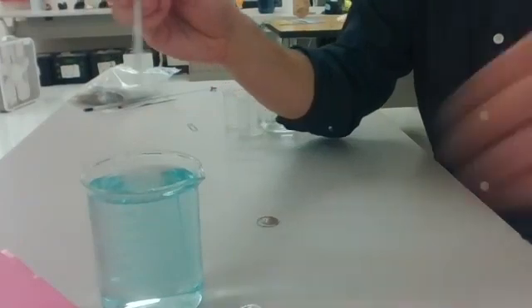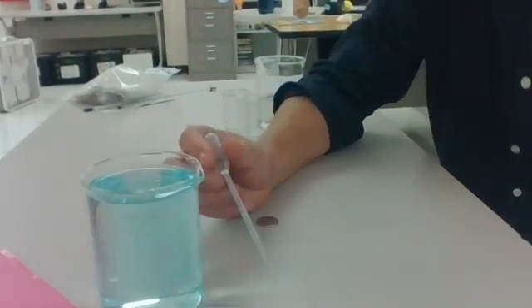An example would be our blood being pumped through our body and the cohesiveness of the cytoplasm in our cells, and our cells being mostly water. So basically cohesion is the idea that water wants to stick to other water, and I'm going to showcase this by taking water and putting drops on a nickel. I'm going to attempt to squeeze out 30 drops on a nickel.